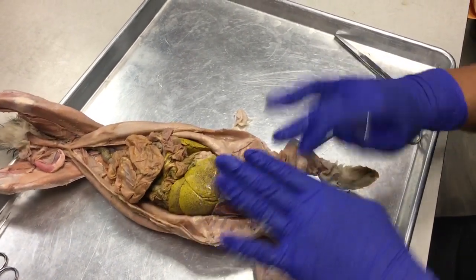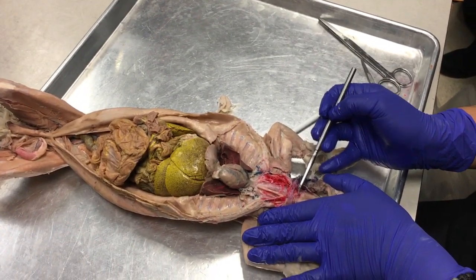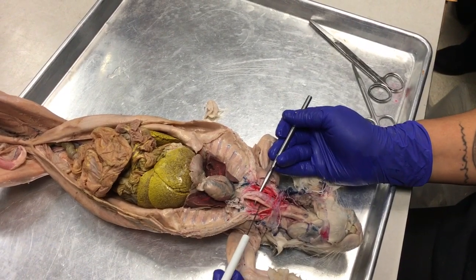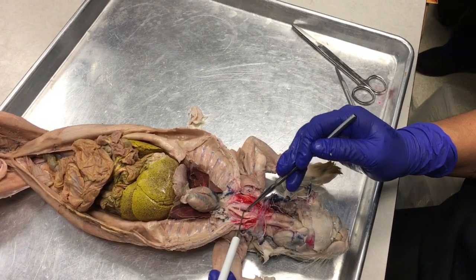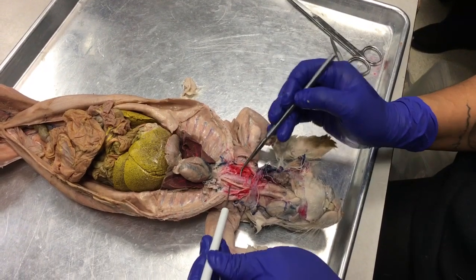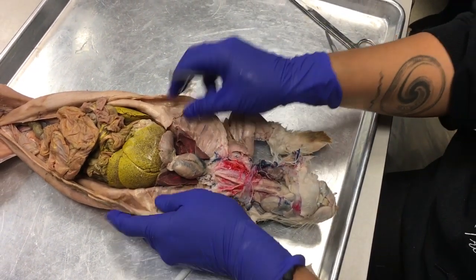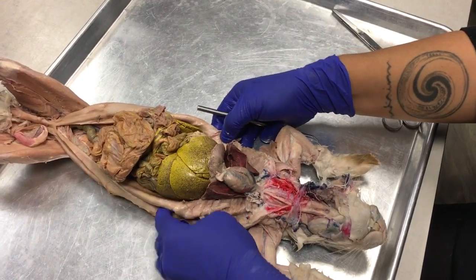Anterior to that, you want to pick away through your sternohyoid muscles so that you can reveal the tubes underneath. Okay, so I have two tubes right here. What do you think this one? Esophagus. Yeah, the other one. Close. And then this one, of course, is trachea. Yes, so you were right. Okay, so we have the trachea and the esophagus, and we can tell because the trachea has these cartilage rings, right? Okay, so now what we're going to do is travel to the abdominal cavity.